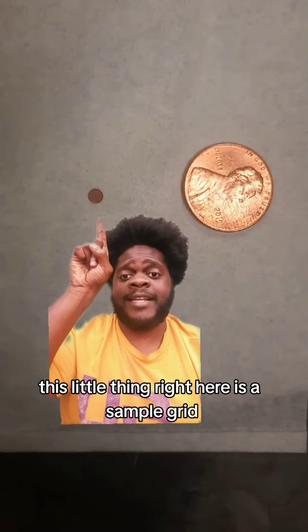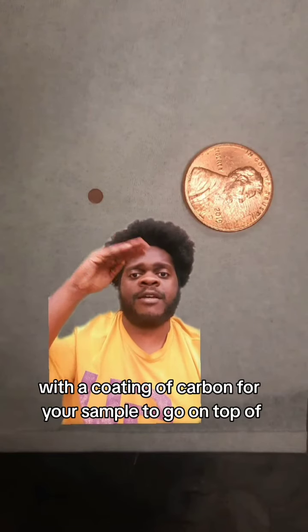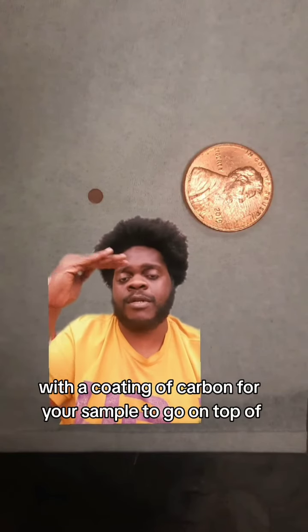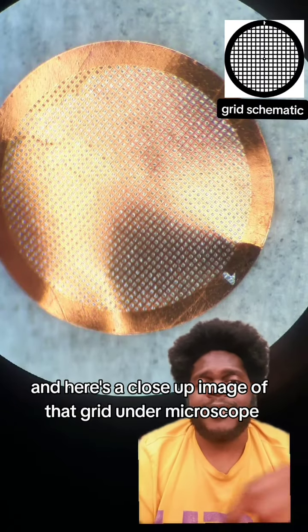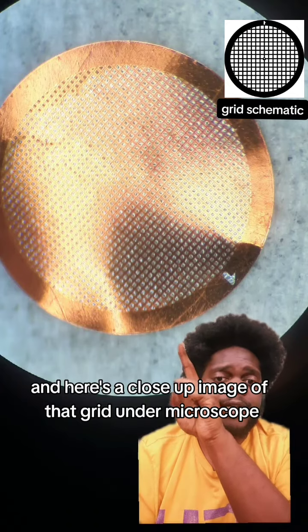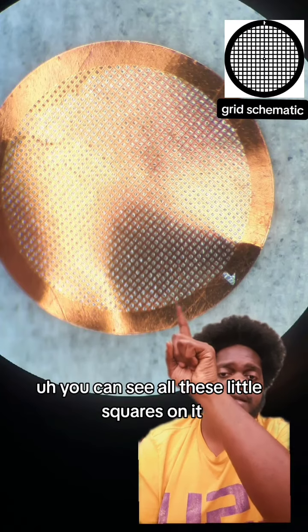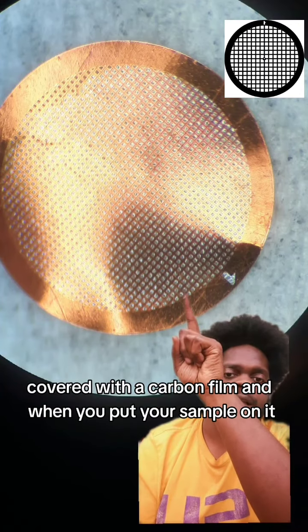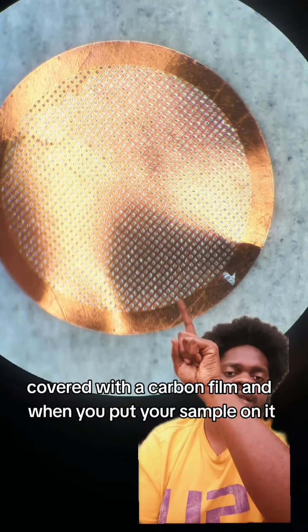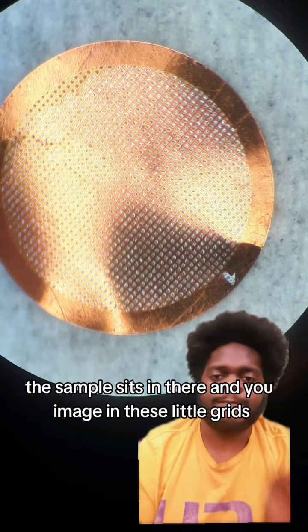This little thing right here is a sample grid. It's a piece of copper foil, essentially, with a coating of carbon for your sample to go on top of. And here's a penny just for scale. And here's a close-up image of that grid under a microscope, a normal microscope. You can see all these little squares on it. These little squares are covered with a carbon film. And when you put your sample on it, the sample sits in there and you image in these little grids.